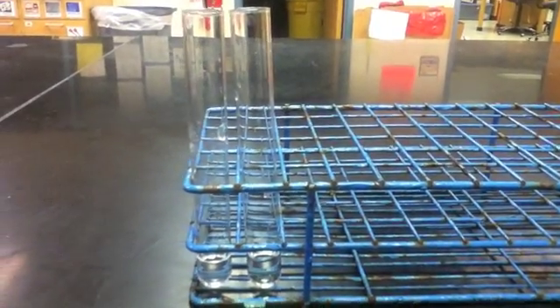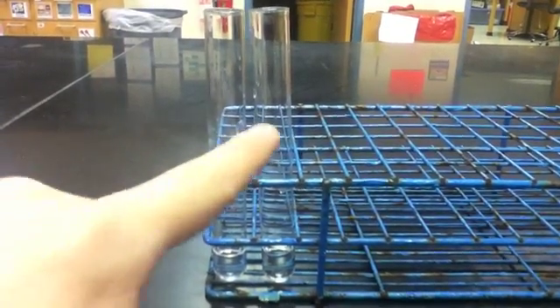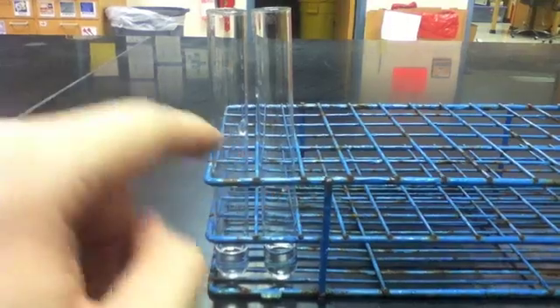I again have placed a different solution in each of these tubes. The tube on the left contains a starch solution, while the tube on the right contains water.